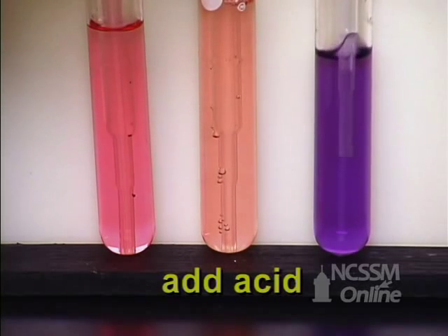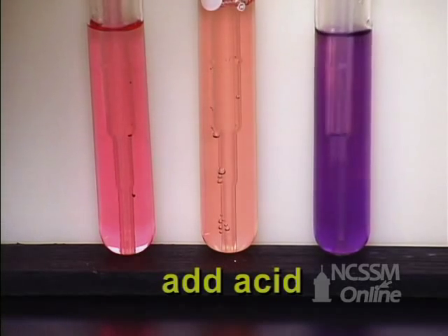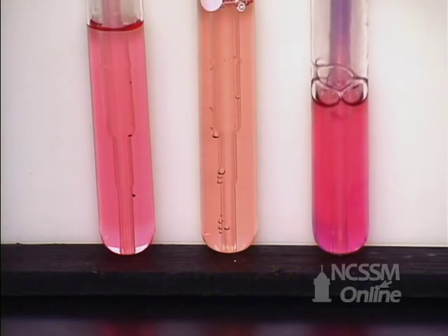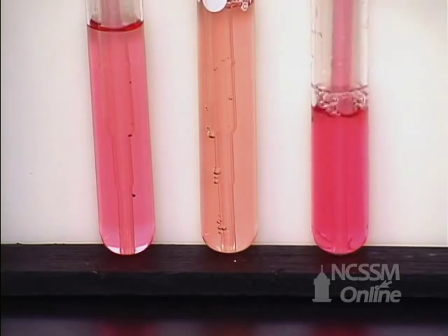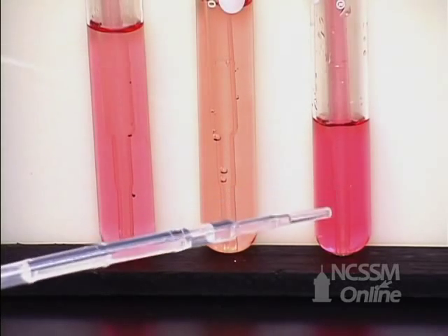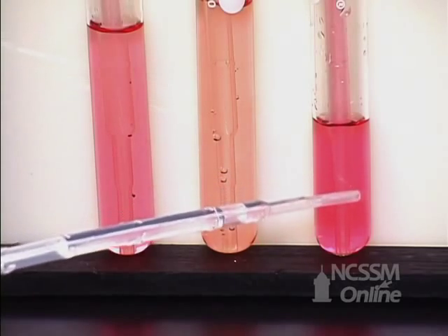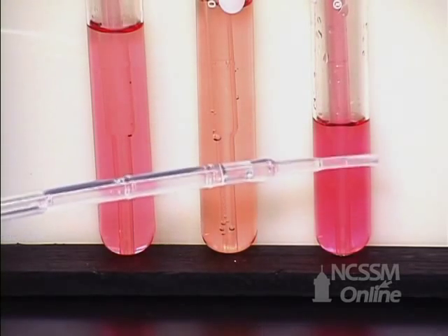If we add acid to this one, water, you can see it only took one drop to change that. So water is not buffered. And one or two drops of acid or base will change the pH dramatically.